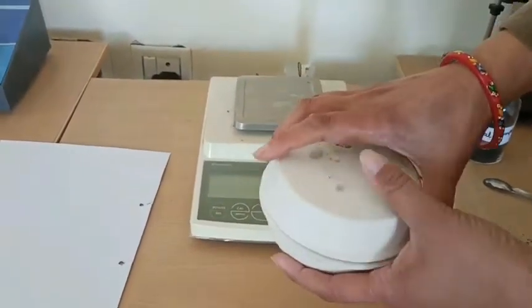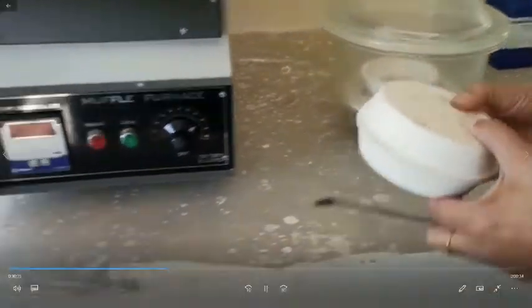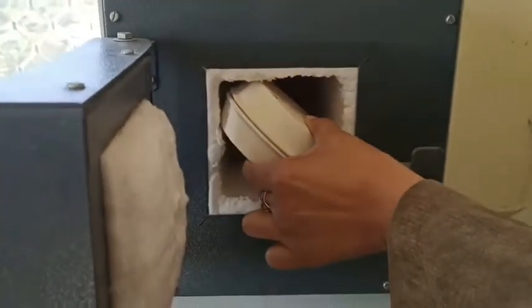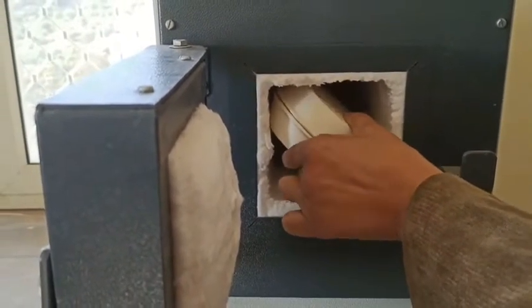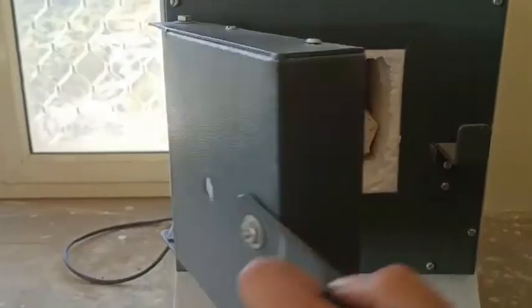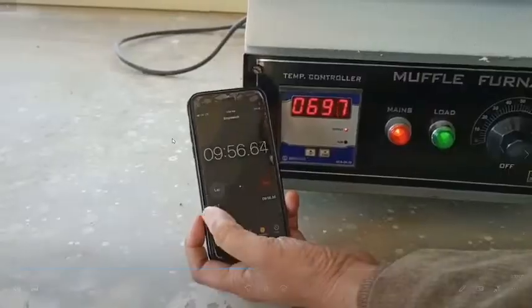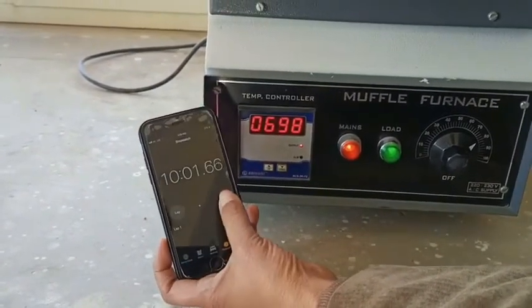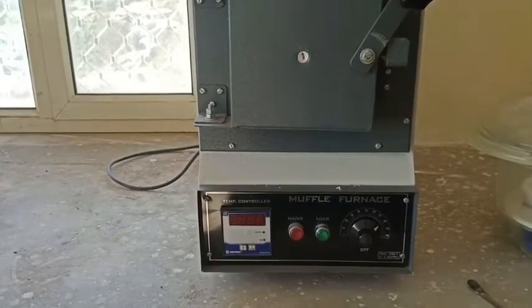Since I do not have such an arrangement for this experiment, it is important to mention that the volatile material experiment is done with the help of a lid without an outlet. We can't do this without a lid. Since I do not have suitable crucibles, I put this sample inside the muffle furnace for half an hour.